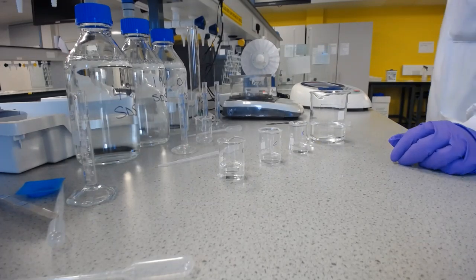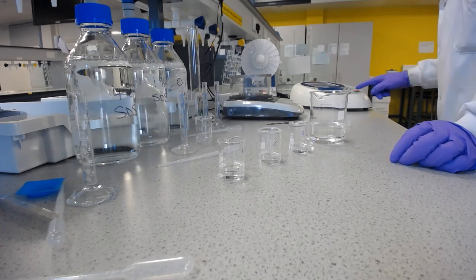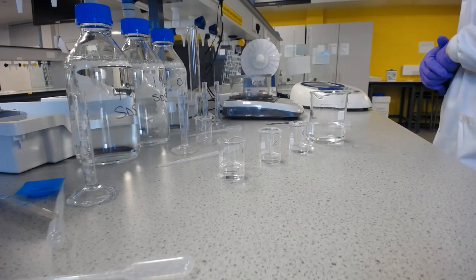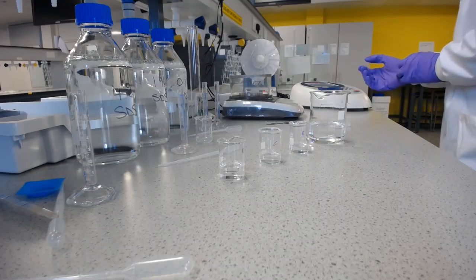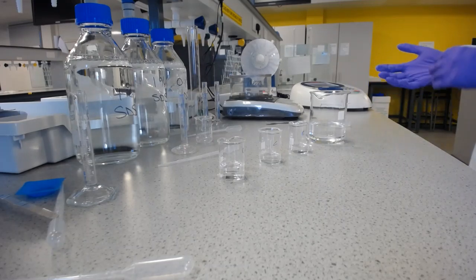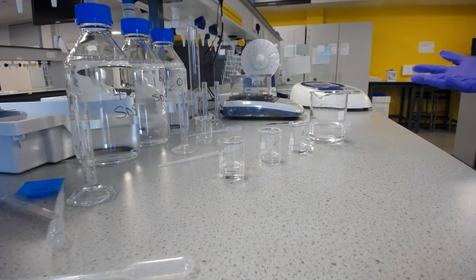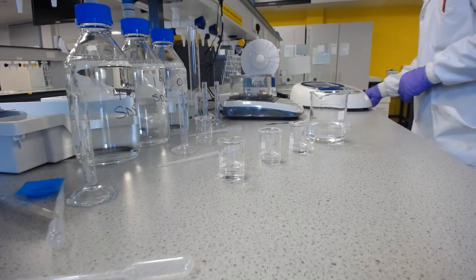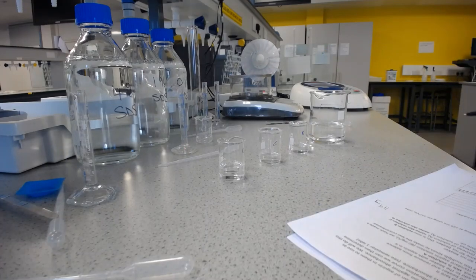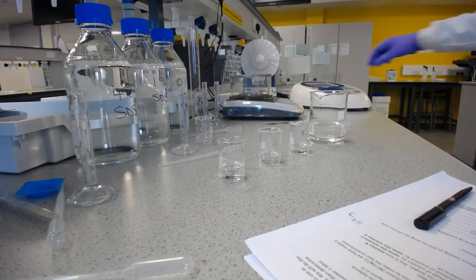I've already set this up to 229 nanometers. And take a 0, there we go. And just to check that, we'll take the absorbance of our blank, our 0. And you may see a tiny fluctuation. I've got minus 0.002. So we can see that that is within just the fluctuations of the instrument. And so I can fill in on the script that the blank UV absorbance is 0. Okay, so that's all set up.